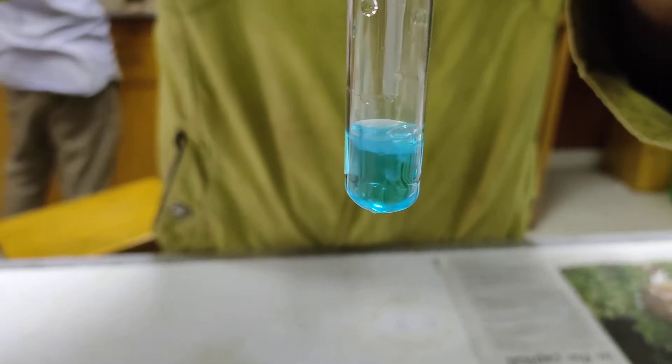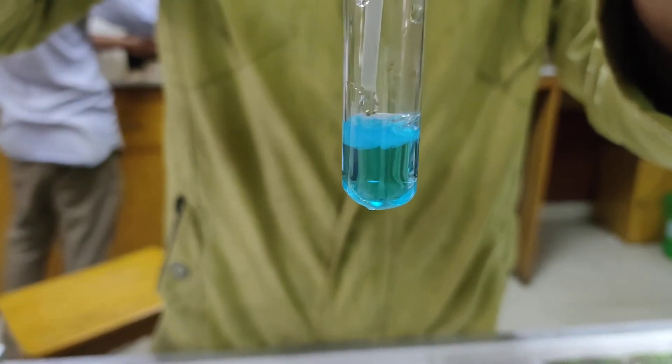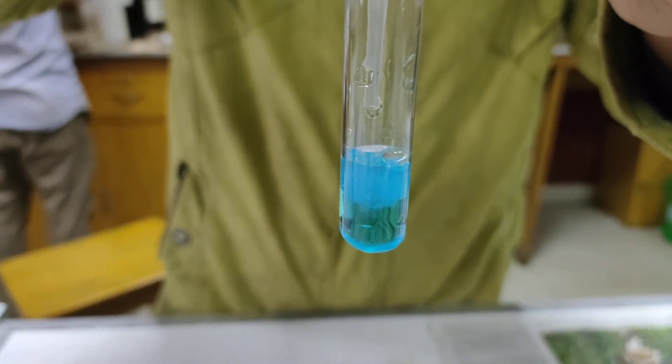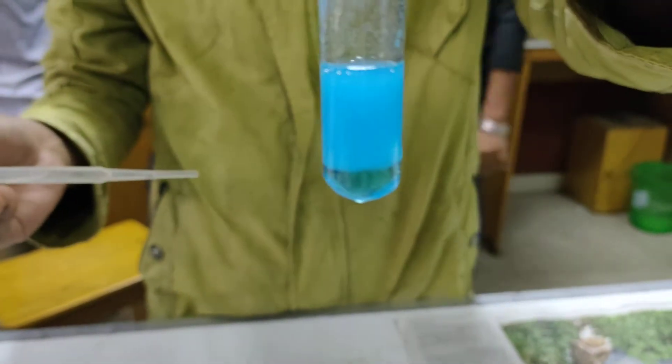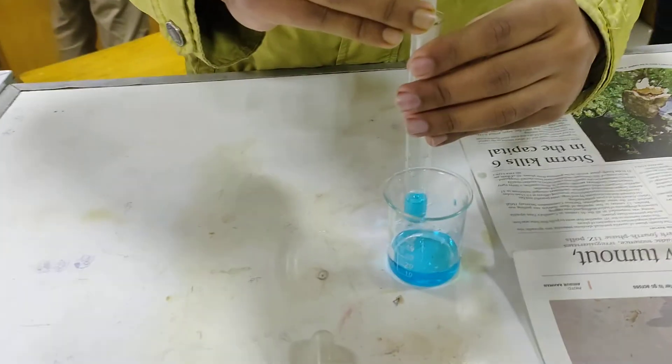This is a blue gelatinous precipitate, which will not dissolve when excess amount of sodium hydroxide is added. He is now adding excess sodium hydroxide — the precipitate is not dissolving. More and more sodium hydroxide is being added, but the precipitate is not dissolving. According to the theory, the precipitate should be insoluble in excess alkali, and indeed it is insoluble. This indicates the presence of copper.